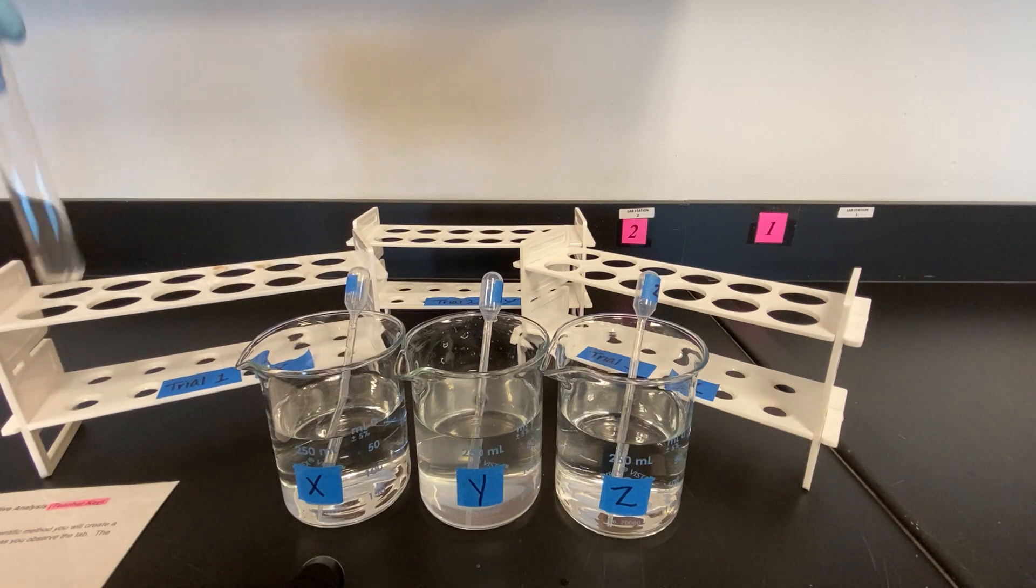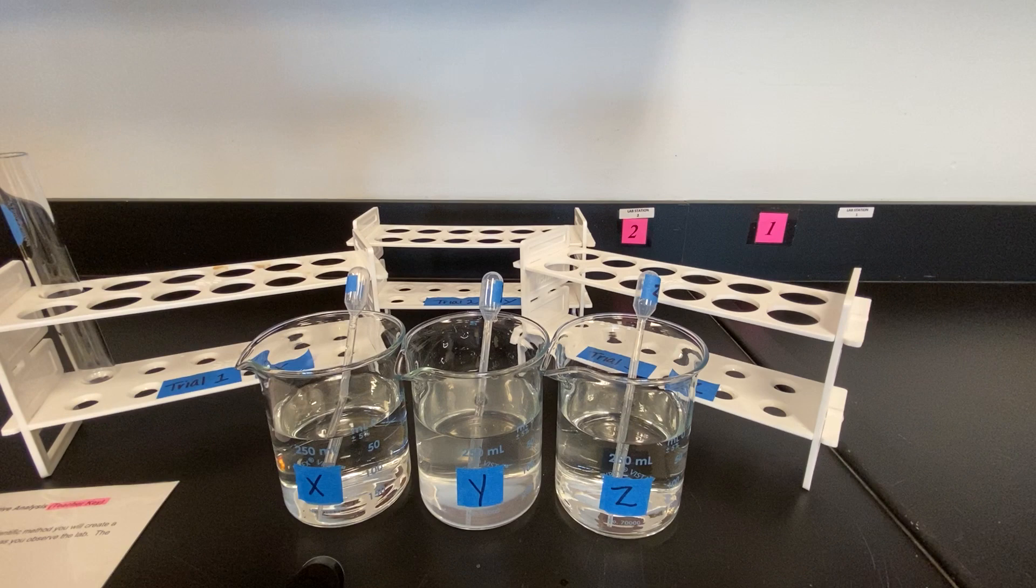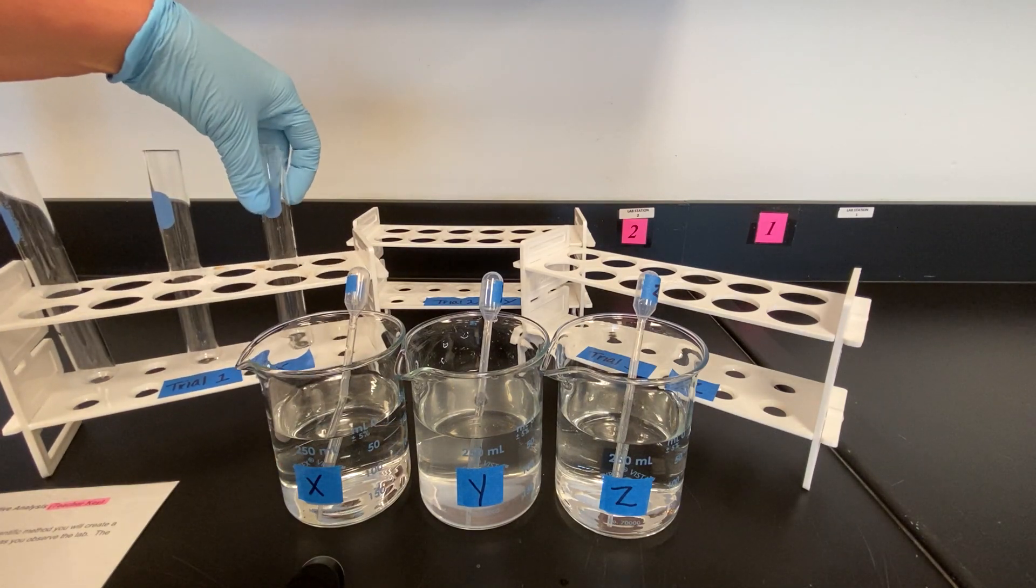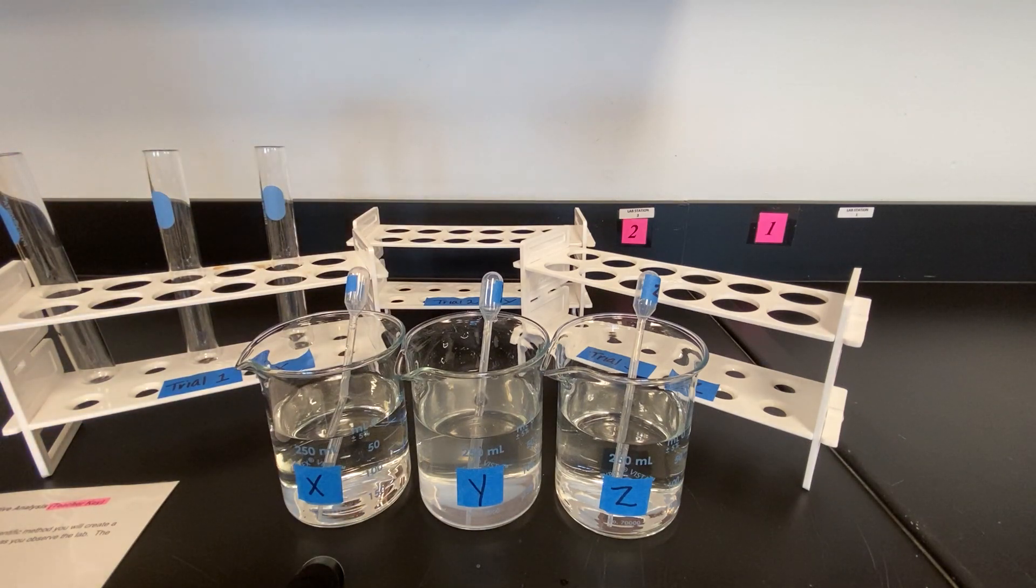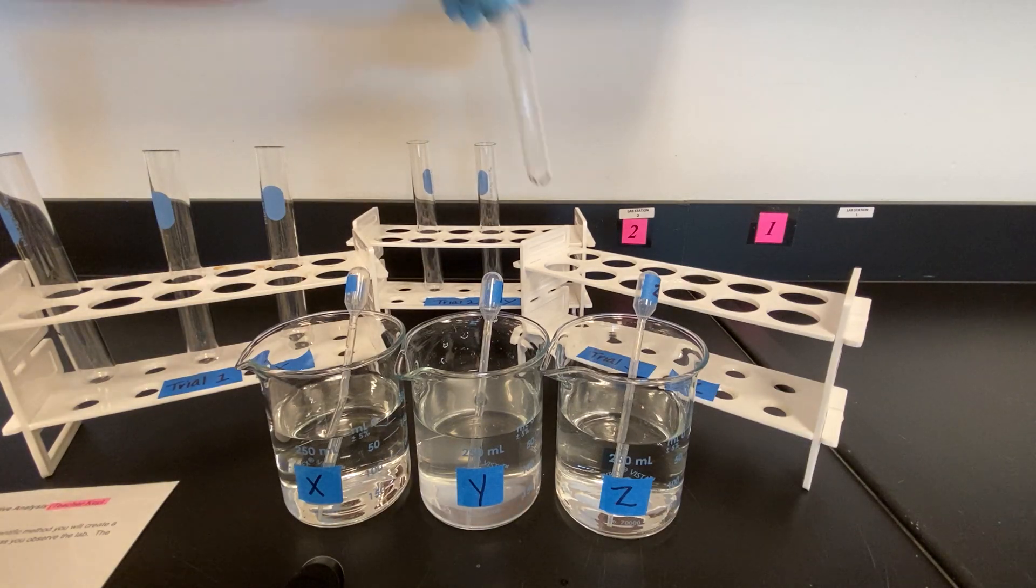You're going to need three test tubes for X, which will be your first trial. You will need three test tubes for Y, which will be your second trial.